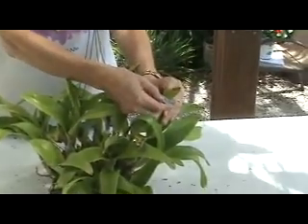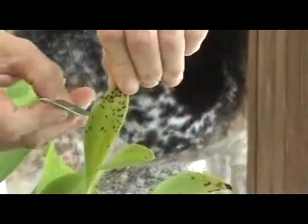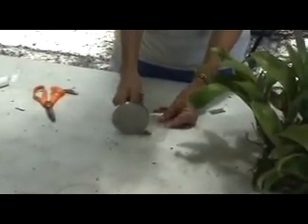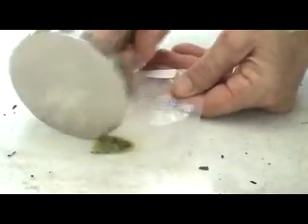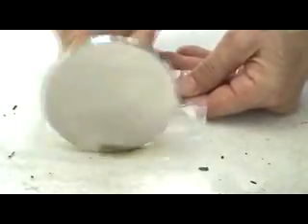We're going to take a sample size about the size of a quarter to put in the bag, taking spotting from the top of the leaf and spotting on the back of the leaf. We're going to drop it into the bag and move it to the bottom where most of the liquid is, then mash it so you can get the plant juices out of the leaf. I'm using the back of a meat tenderizer. As the plant sap comes out you can see that greenish color — that's the chlorophyll being dissolved in the buffer solution.